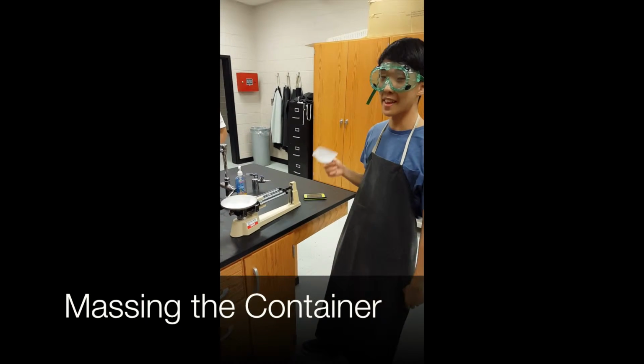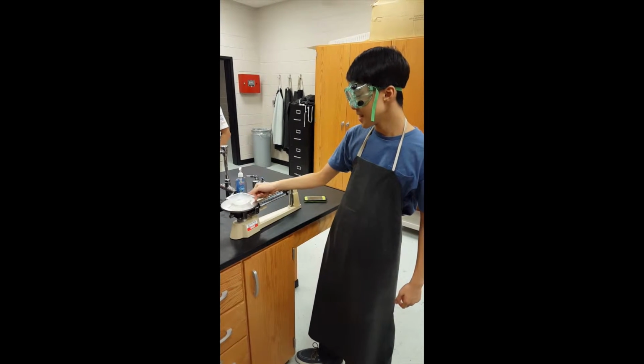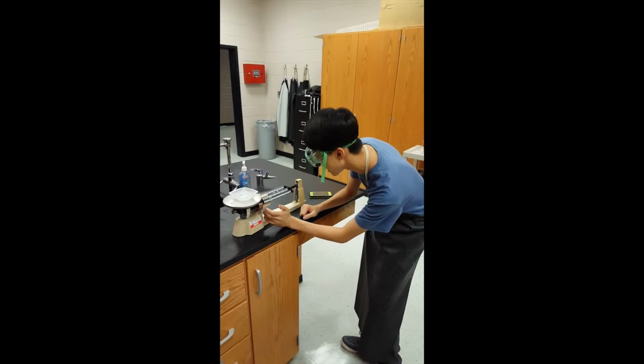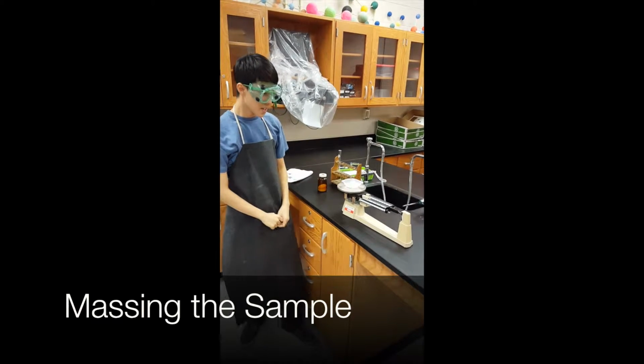First, you must measure the mass of the weigh boat. Place it on the scale and move the weights until the balance is at 0. And it looks like the weigh boat is about 2 grams in mass. In this case, our chemical will be sand.